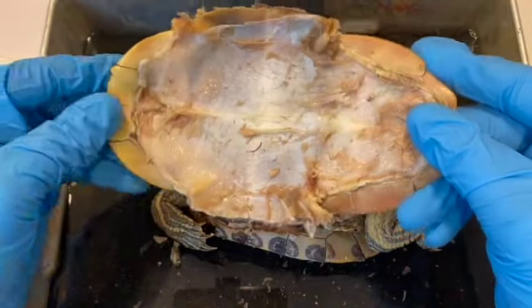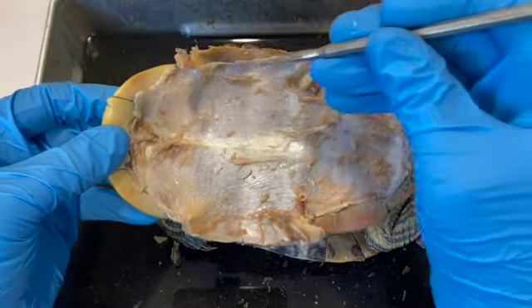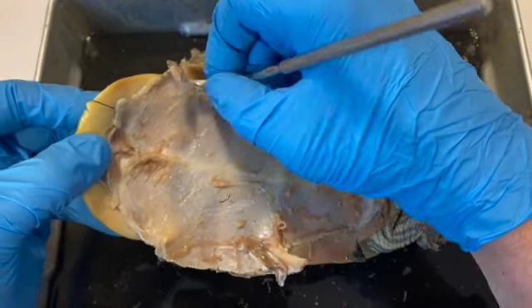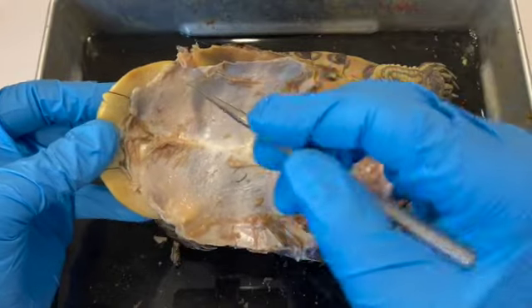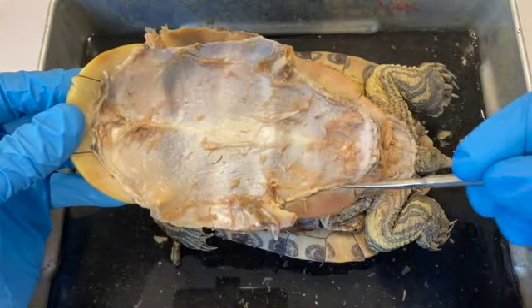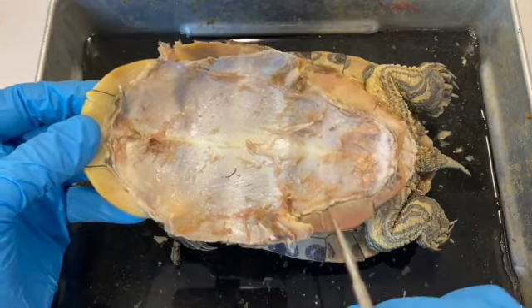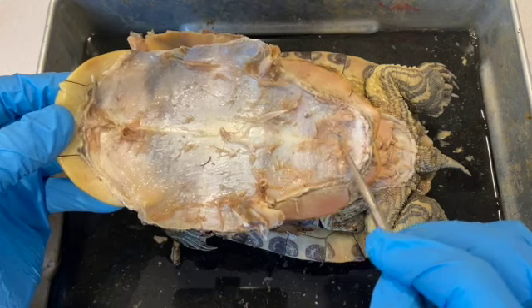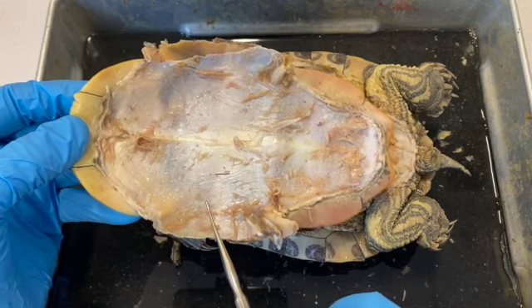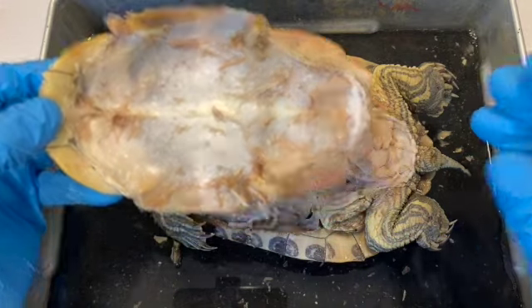So here's the plastron, and this white material that we see lining the plastron is a dense connective tissue, and it's very tough. You'd have a very hard time ripping it off, and this is the stuff you have to cut through along the edges with your scalpel in order to get access to the inner surface, and then scrape away from the edges on in. This kind of brownish material, this tan material, is muscle. And so anyway, if you do a good, careful job, you'll preserve a lot of the muscle attachments inside, so you can see the muscles in place.